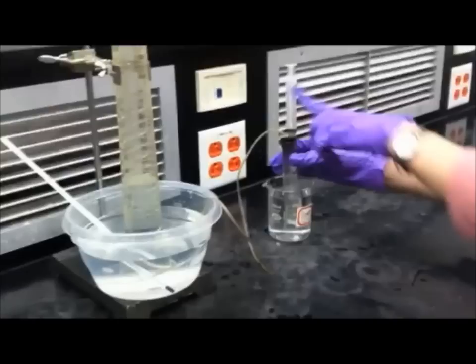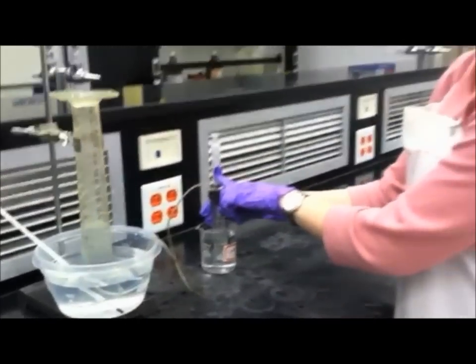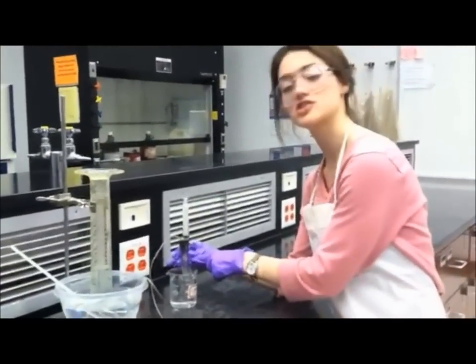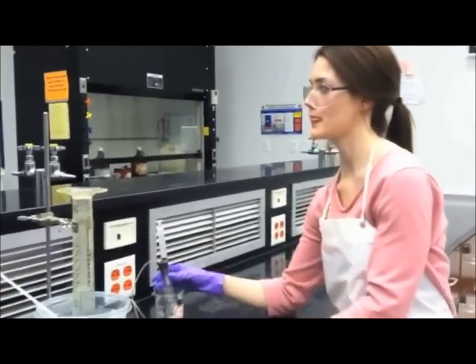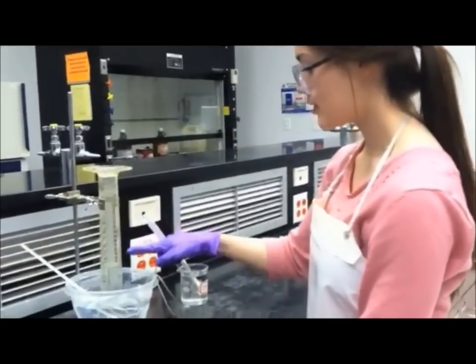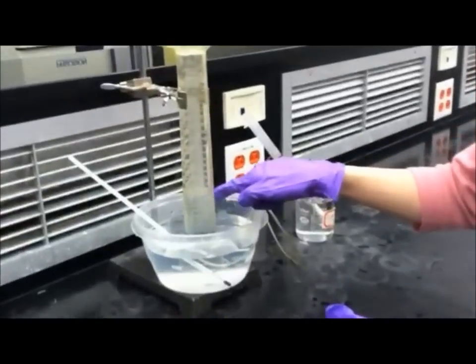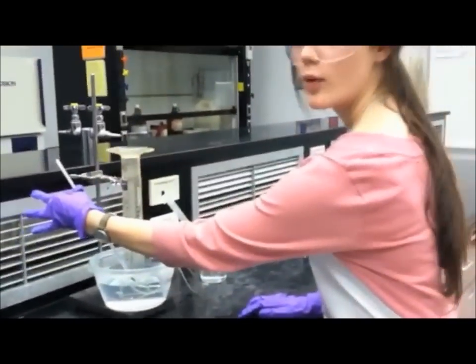And make sure, the reason you're doing this slowly is because the reaction is exothermic. And if you do it too quickly, you can actually shatter your test tube. And now this is the perfect time to record the final volume and also the temperature of your water.